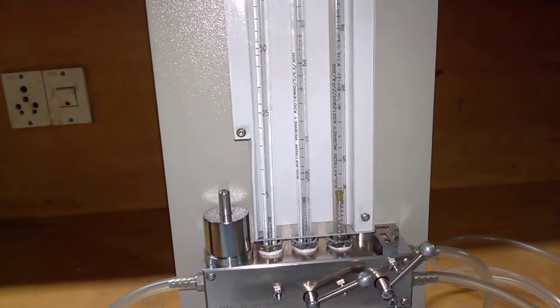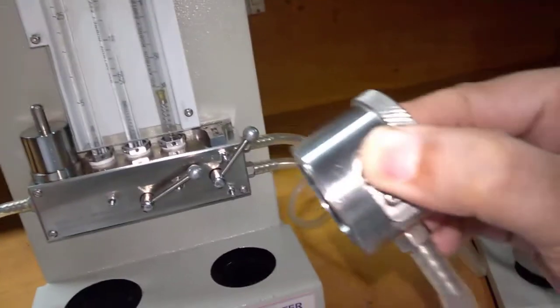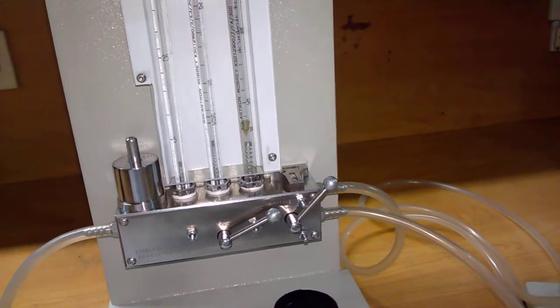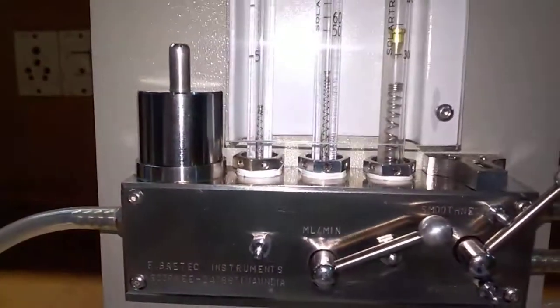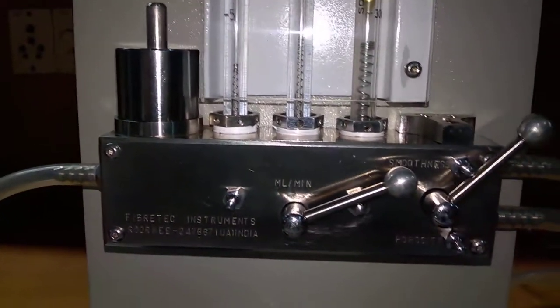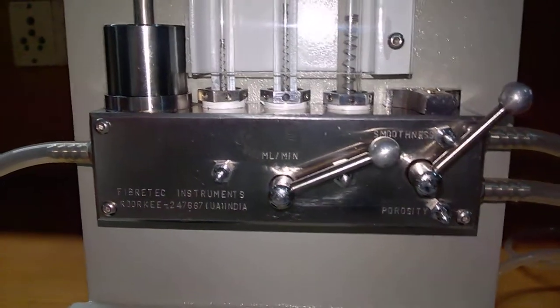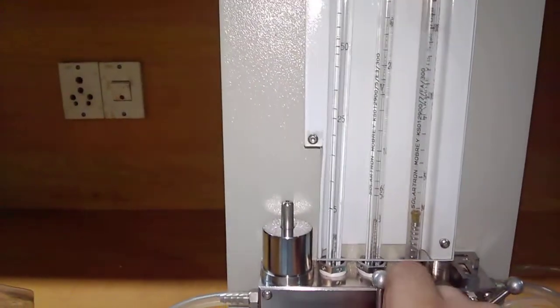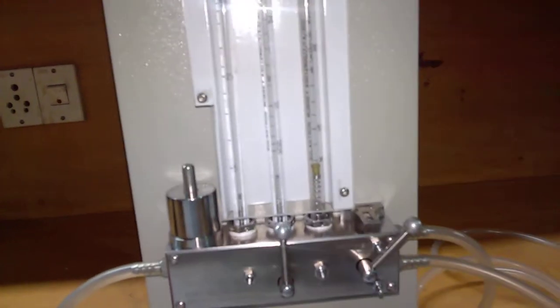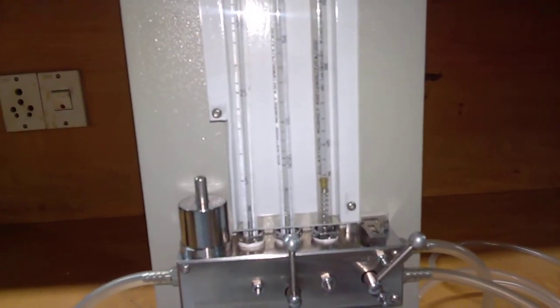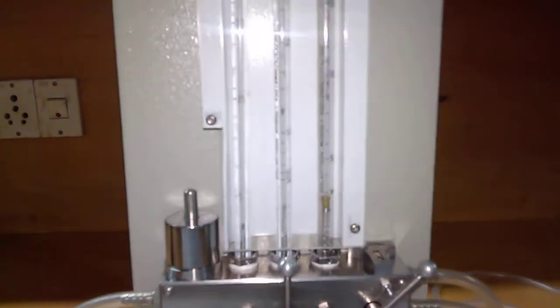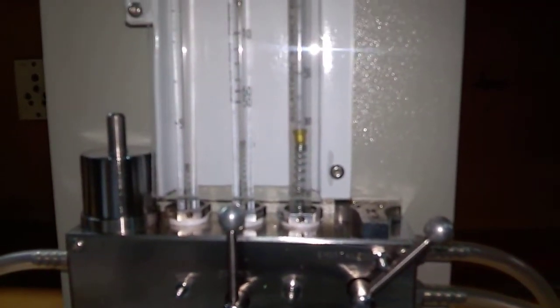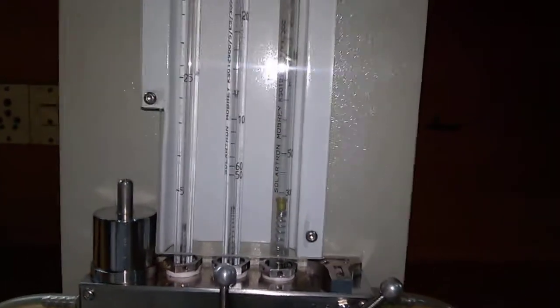Similarly, we can hold this knob, place it over here, and leave it. It gives more than 500 ml per minute. It's 400 ml per minute. We can check it at this position. It is 120 ml per minute.